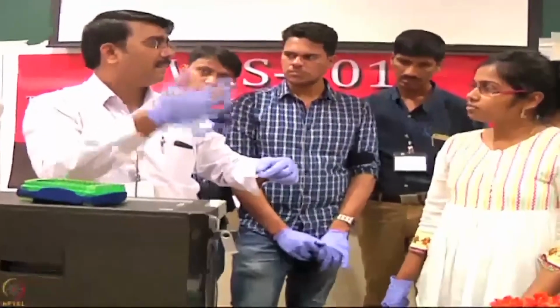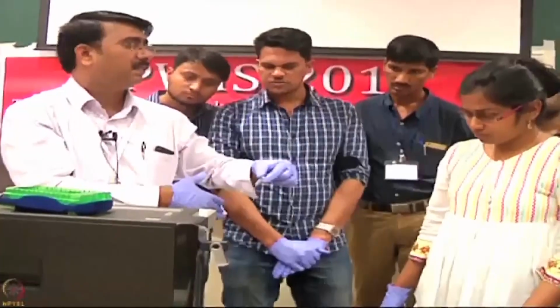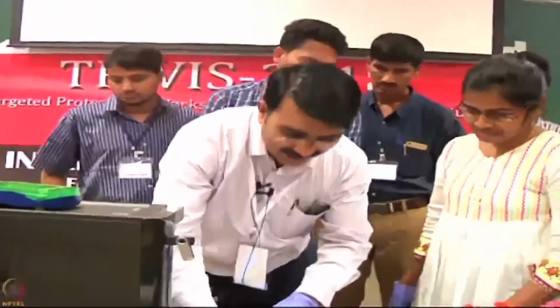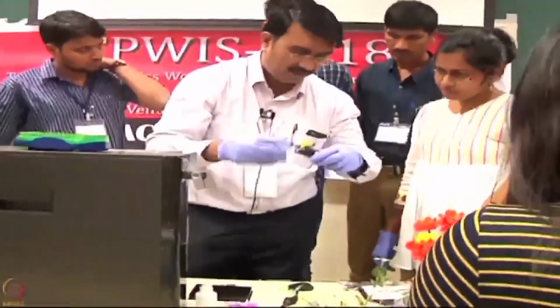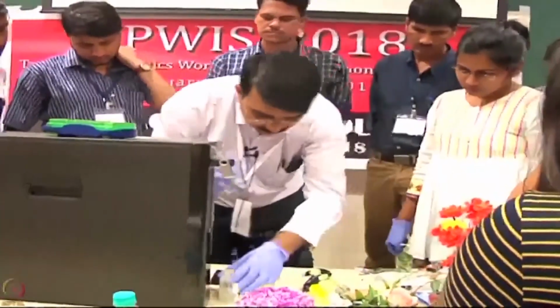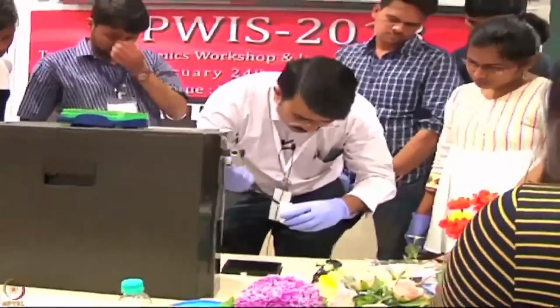Take 100 microliter, transfer, and mix thoroughly. Then take 100, then mix it. Otherwise I will do it, not a problem here. So the last one is buffer.